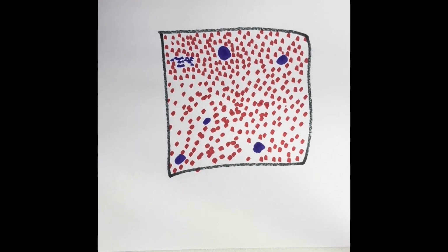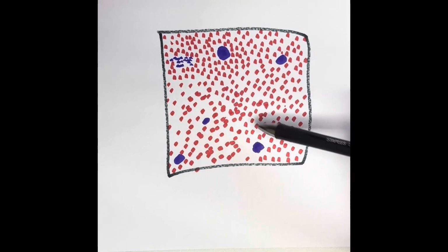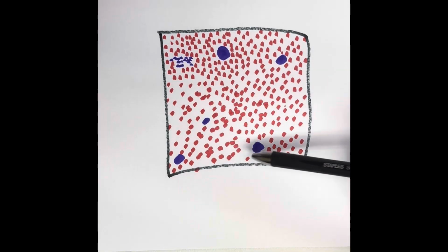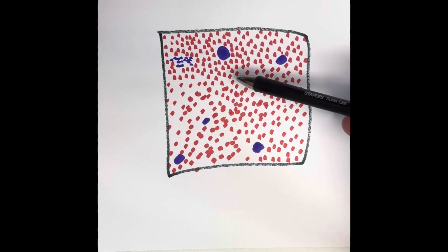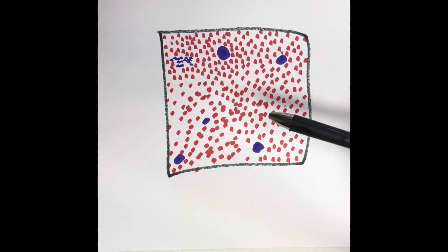All right, here is the blood connective tissue. Blood connective tissue is in liquid form. The matrix is in liquid form, which is the negative white space. All around the matrix, the cell-like structures are known as formed elements.